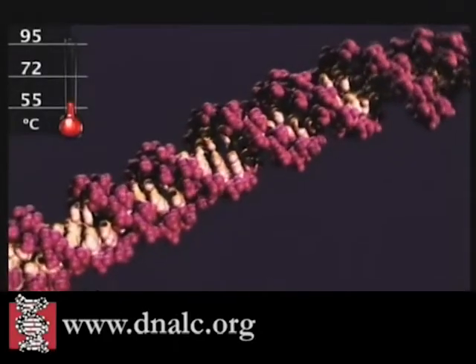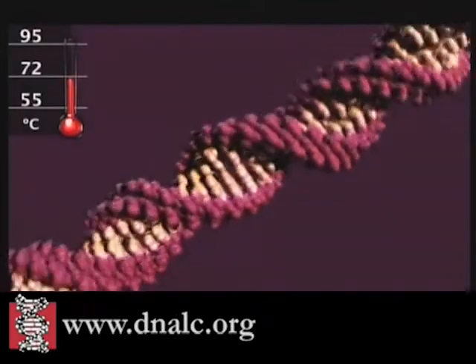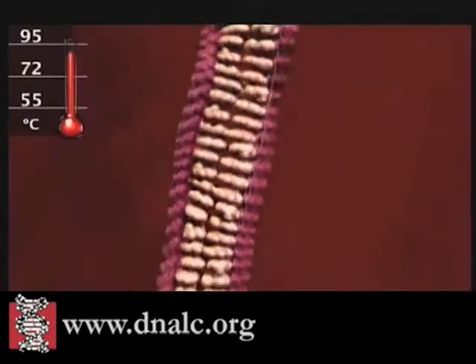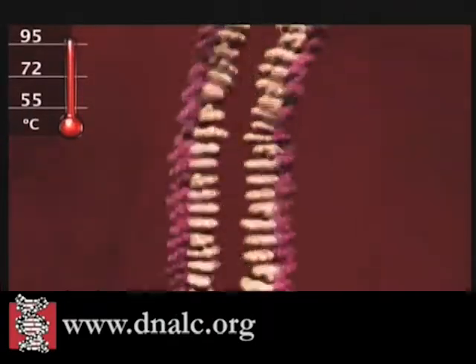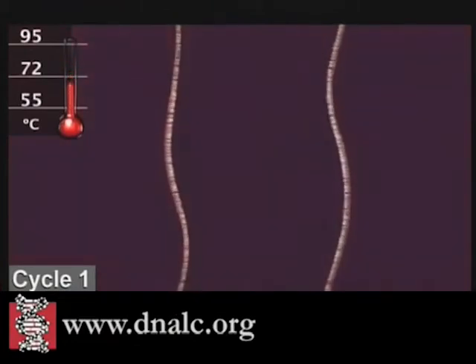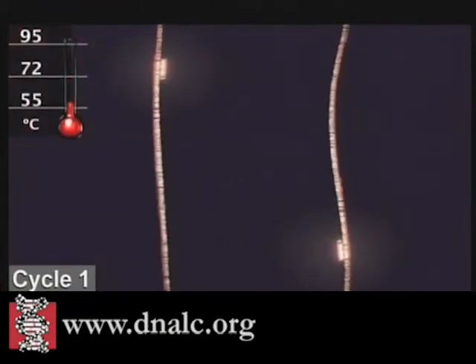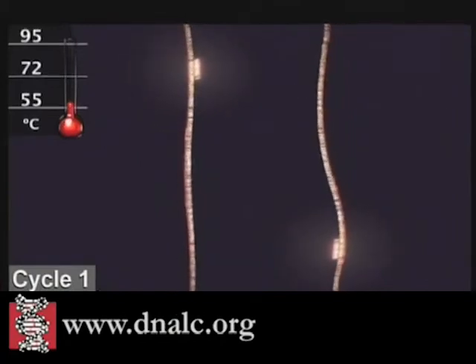PCR copies DNA, so a small amount can be amplified to a level that we can detect and analyze. Polymerase chain reaction, or PCR, uses repeated cycles of heating and cooling to make many copies of a specific region of DNA. First, the temperature is raised to near boiling, causing the double-stranded DNA to separate or denature into single strands. When the temperature is decreased, short DNA sequences known as primers bind or anneal to complementary matches on the target DNA sequence.